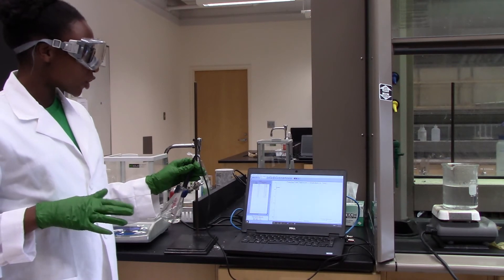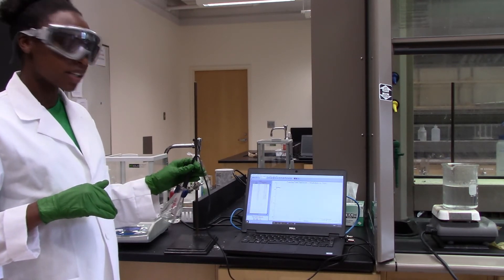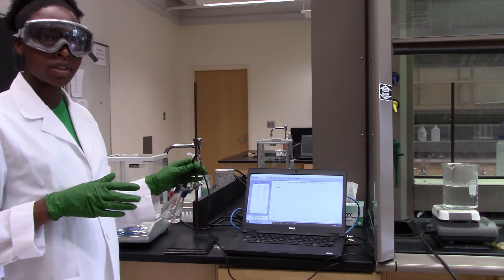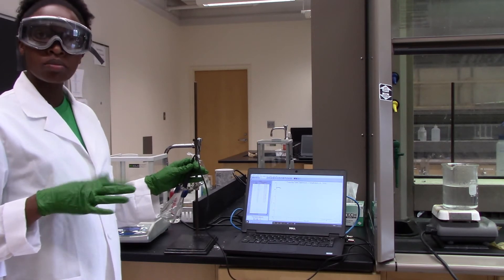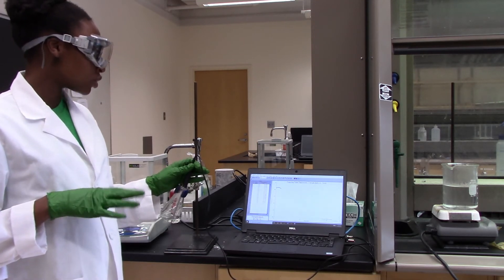Okay, so you can see here that the starting temperature is about 62 degrees Celsius, and I am going to keep stirring this liquid so that I have a uniform temperature as it drops from 62 degrees Celsius.